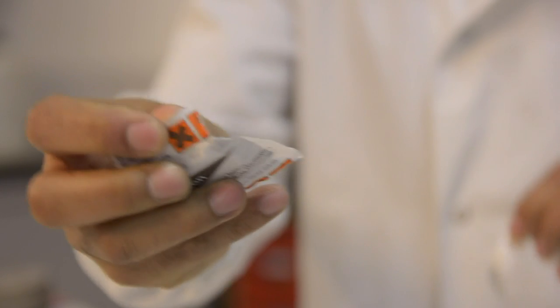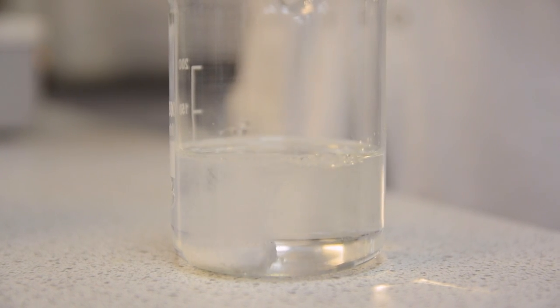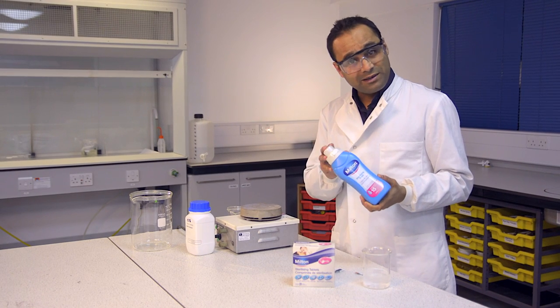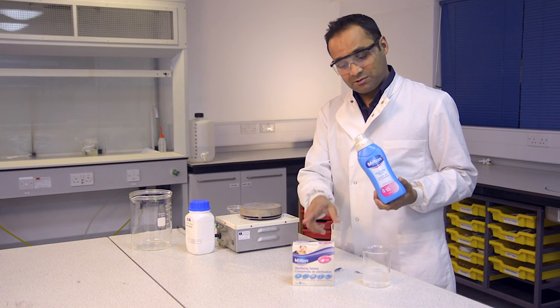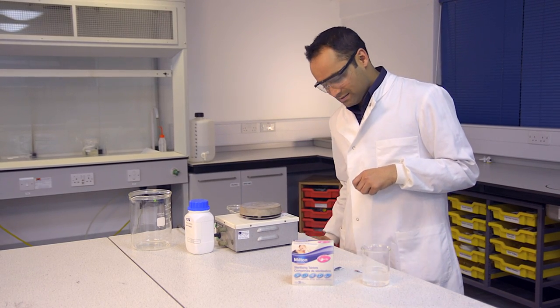You simply take the tablet out and drop it into the water. You can buy sterilising fluid, but it is in fact a different chemical to the one in the tablets, so make sure you use those and not this. When this is ready, I'm going to add some of it to the agar solution, but I have to do that in the fume cupboard because there is a possibility that chlorine gas will be produced.